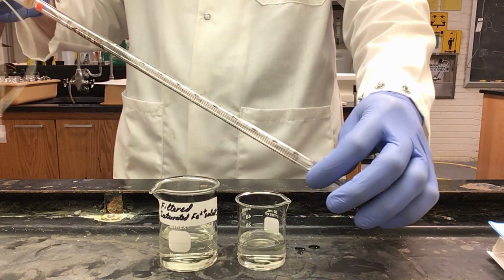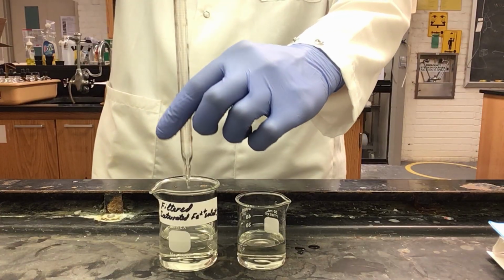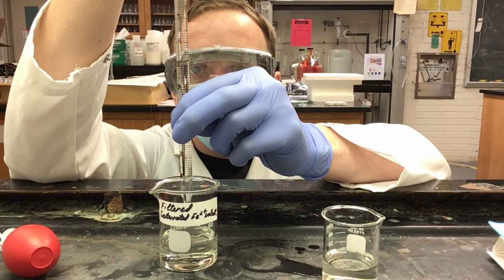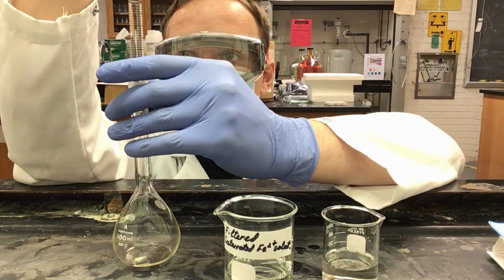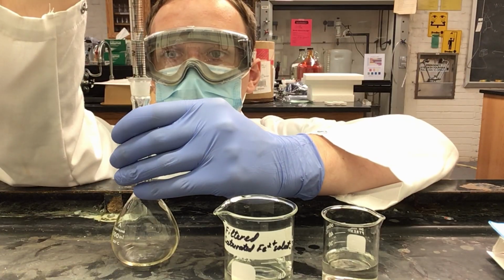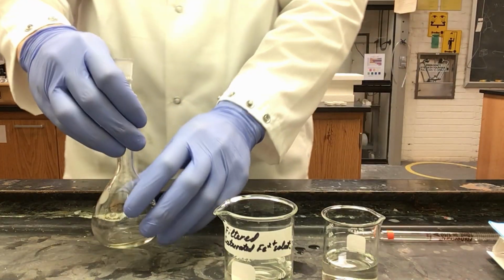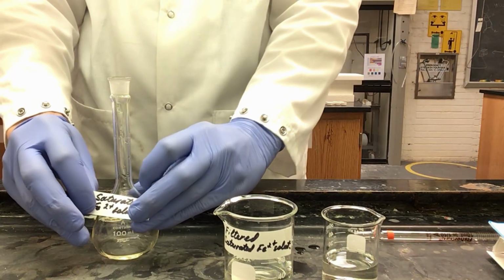So now that we have rinsed our pipette, we can get 5 milliliters of our solution. Just as before, we are using our thumb in order to cap the glass pipette. I take and add my solution to my volumetric flask. I want to stop at the 10 mL mark since I only need the 5 milliliters and we do not want to use solution that is in the tip. Now that we have solution in our flask, we can label it as our saturated solution flask.